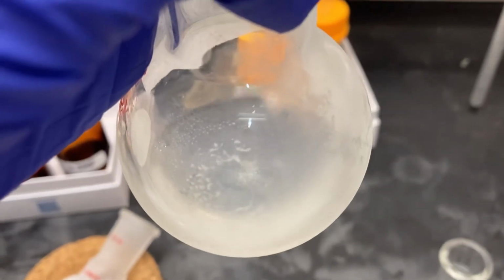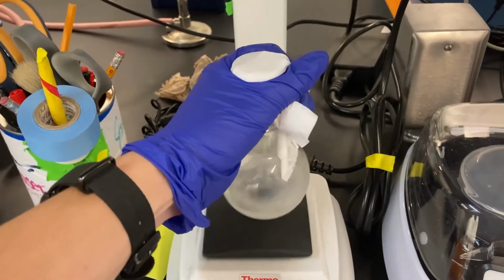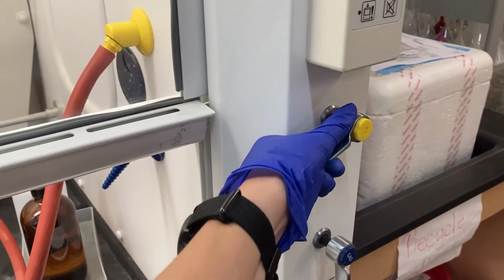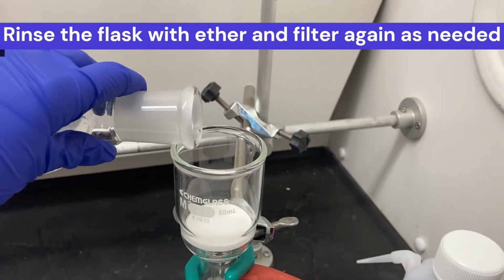If it doesn't initially crash out, try adding a few drops of water, vortexing the solution, or carefully scratching the bottom of the flask with a metal spatula. When your peptide is crashed out, turn on the vacuum and filter your solution through the glass filter. A white powder should be left behind in the filter.